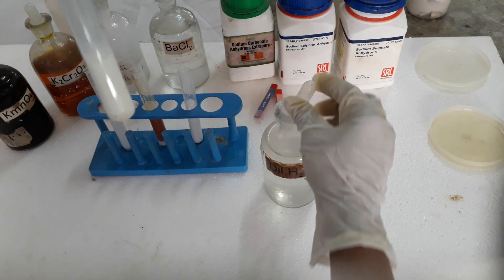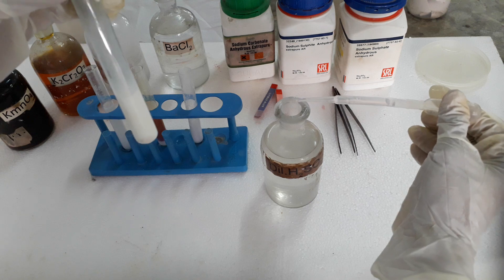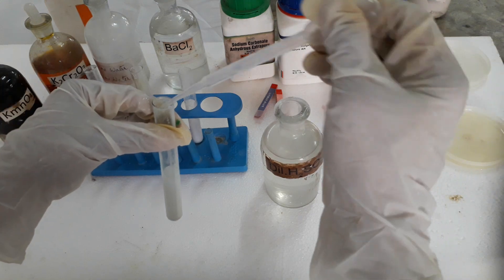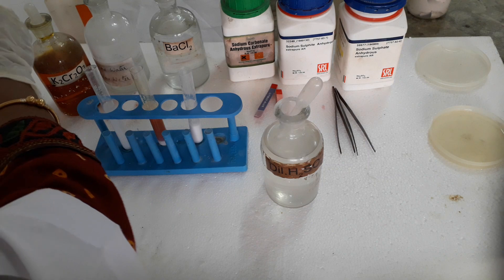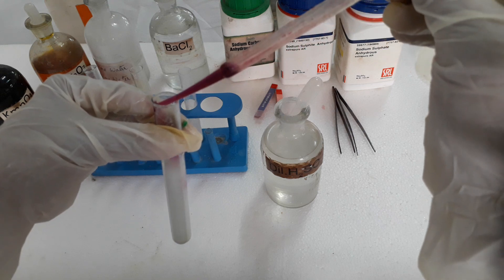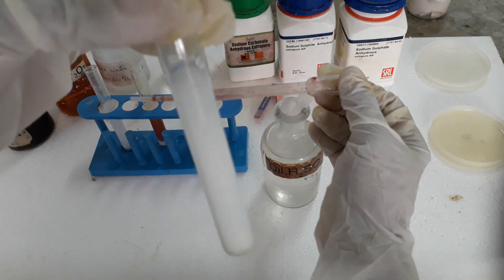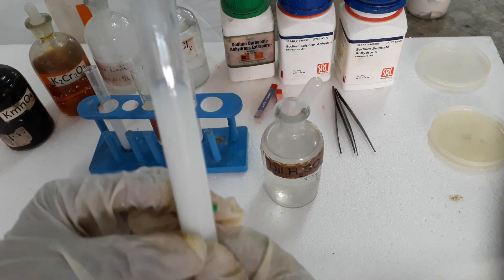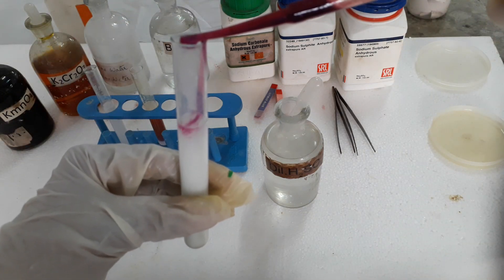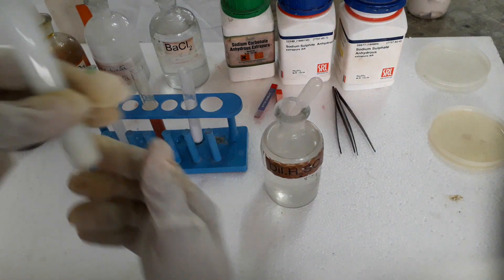Now let us take the second test tube — sodium sulphite, to which we added barium chloride to form barium sulphite. On adding dilute sulphuric acid, the precipitate dissolves and sulphur dioxide gas is liberated. To confirm the gas is sulphur dioxide: on adding pink potassium permanganate solution, it turns colorless. See — the pink potassium permanganate is turning colorless, confirming SO₂ gas.